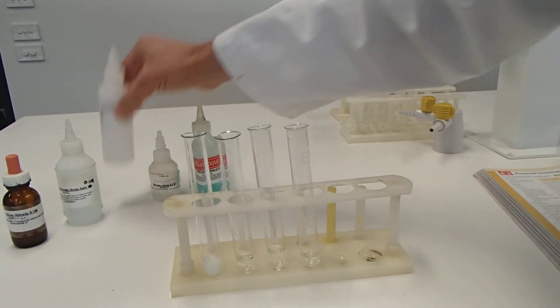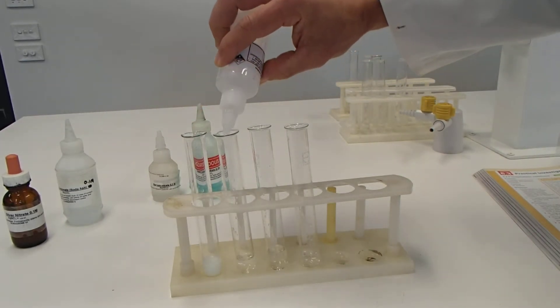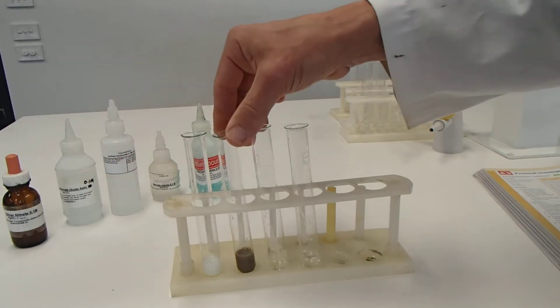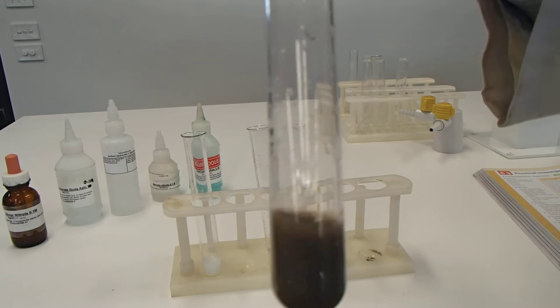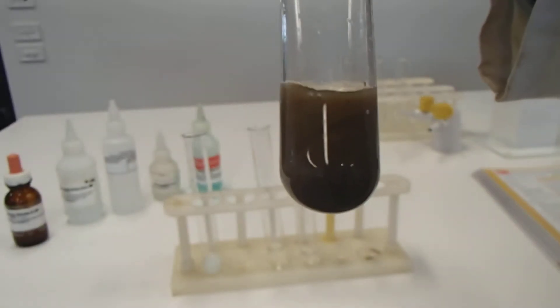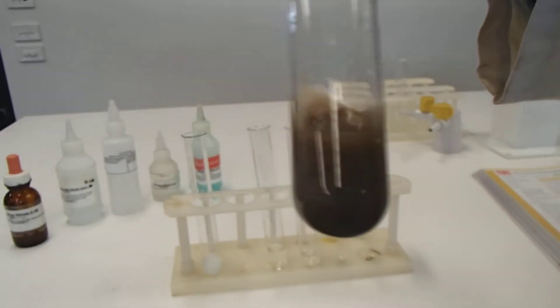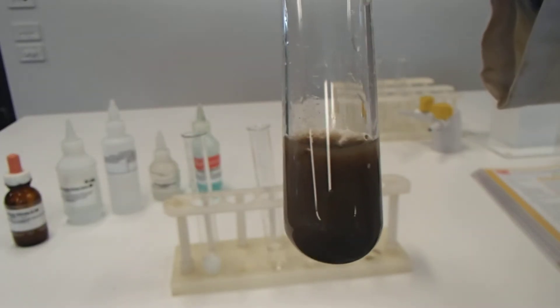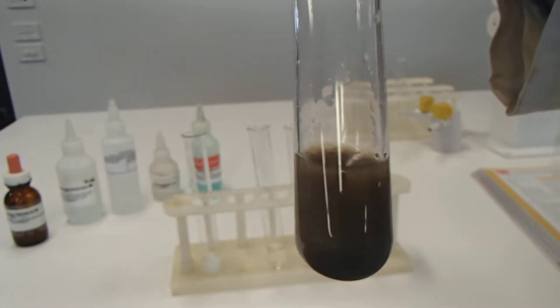Next comes the sodium hydroxide. Remember, we're crossing all of these with silver nitrate. Wow. That was dramatic. You would have seen that straight away. Looks like mud. It's brown. I can't see through it. I can see particles floating in it. I'll let you decide whether you think a precipitate or a solid was formed there.